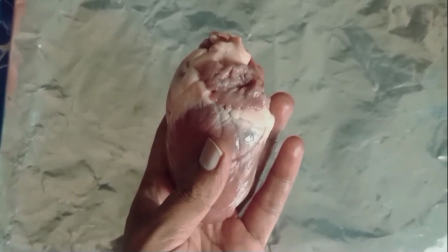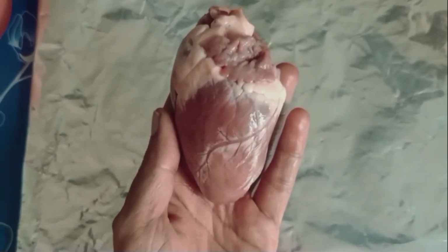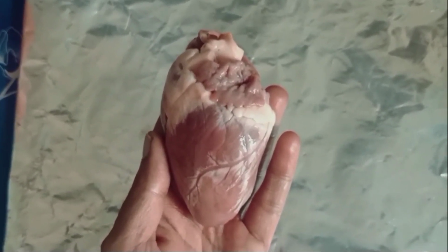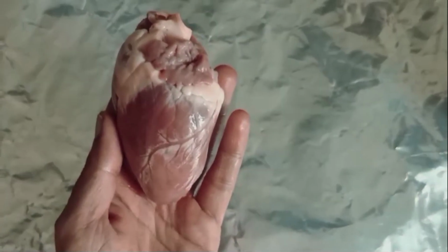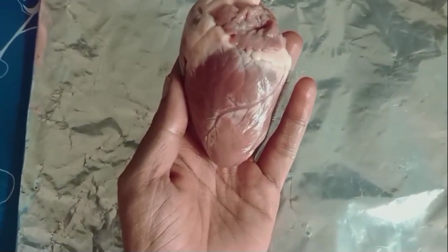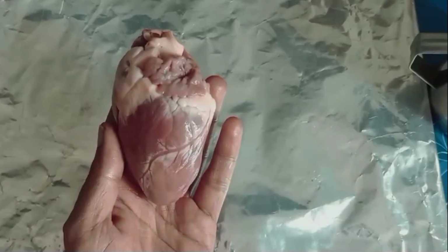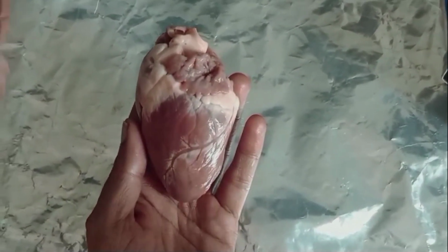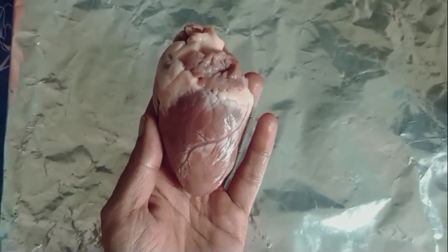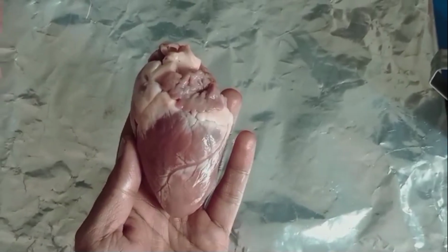To observe the mammalian organs, we need some materials here. One is the freshly collected goat kidney we required, right? We also need a sharp scalpel to cut the heart, a jug of water to clean the heart, and a few pen refills we collected to be inserted in the blood vessels, right?